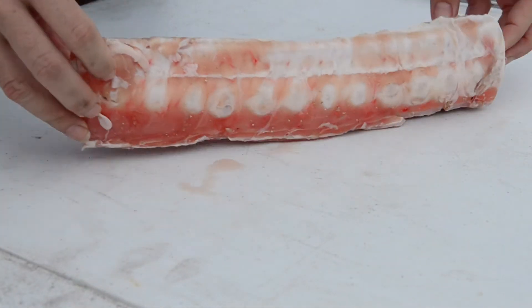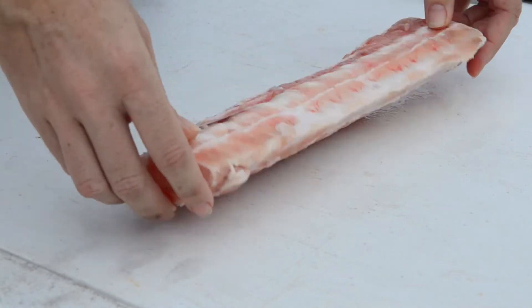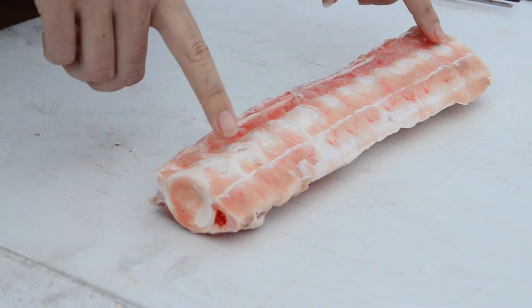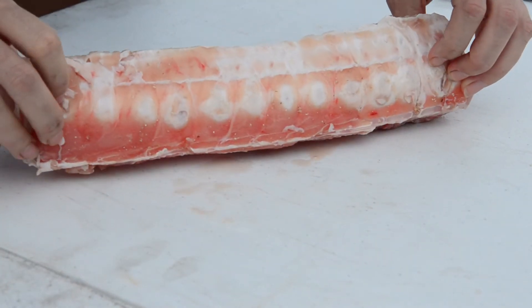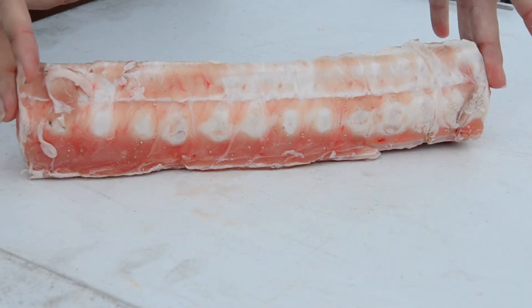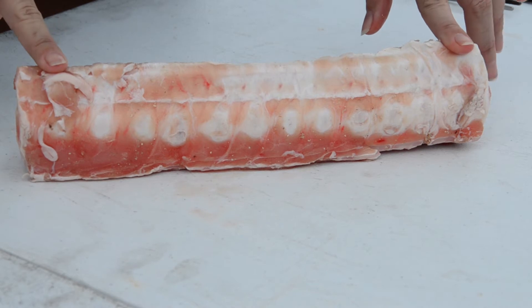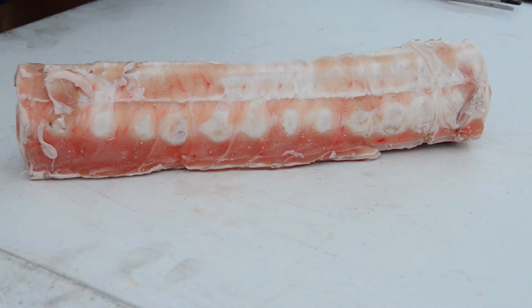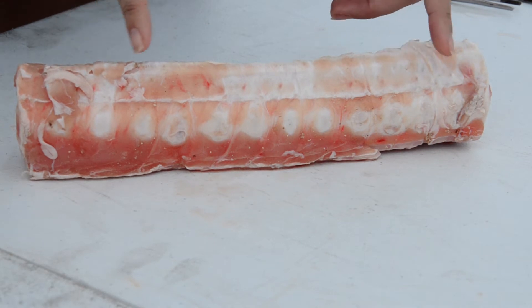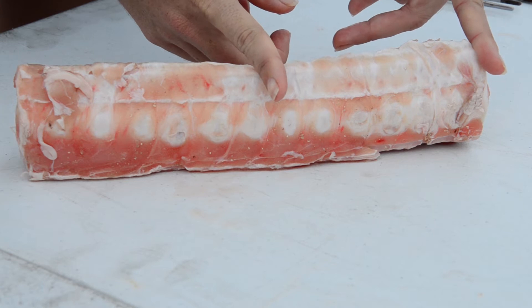This is part of the backbone of a hammerhead shark and you can see we have approximately 12 to 13 individual shark vertebrae here. We want to try to get between five and ten. Smaller sharks have smaller vertebrae, so with a more coastal shark like a black tip or a Caribbean reef you could take a section this way and still get your ten vertebrae.